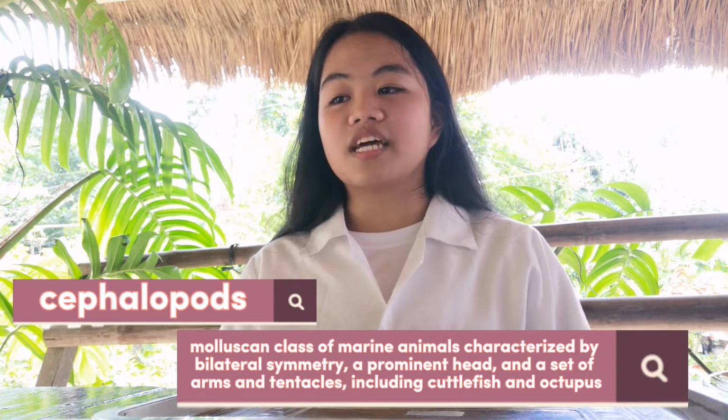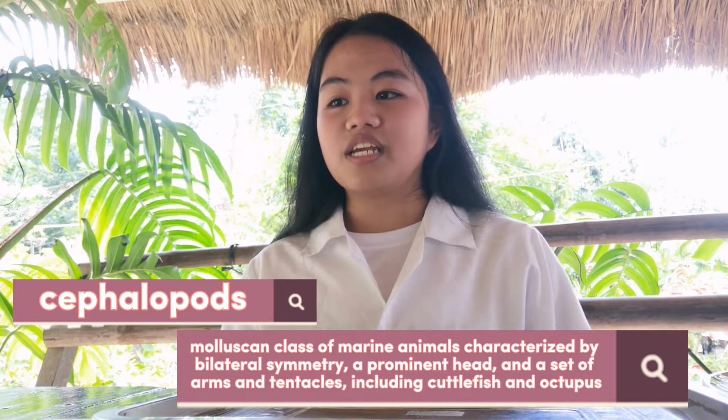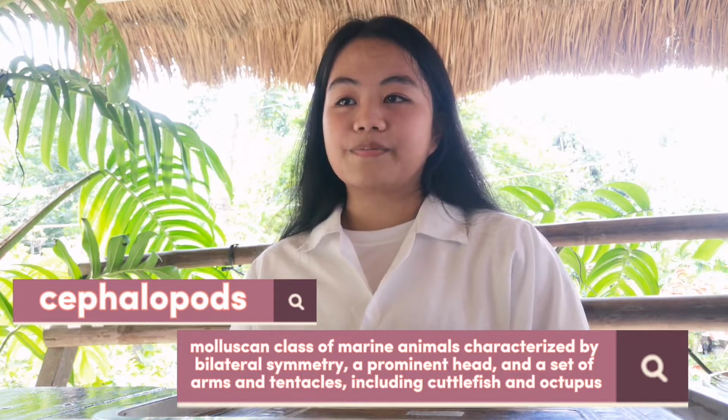I'm from BS Psychology 1E, and for today's video, I'm going to show you the anatomy and physiology of a squid by performing squid dissection. So I'm going to give you a short description about squid. Squids are part of a group called cephalopods. Cephalopods are molluscan class of marine animals characterized by bilateral symmetry, a prominent head, and a set of arms and tentacles, which includes other animals like cuttlefish and octopus.